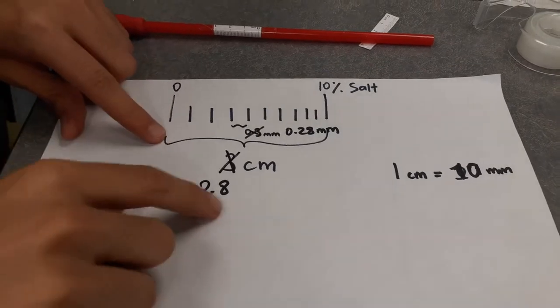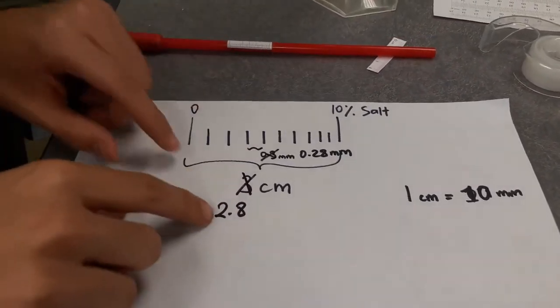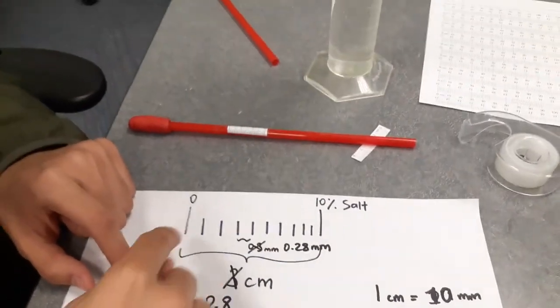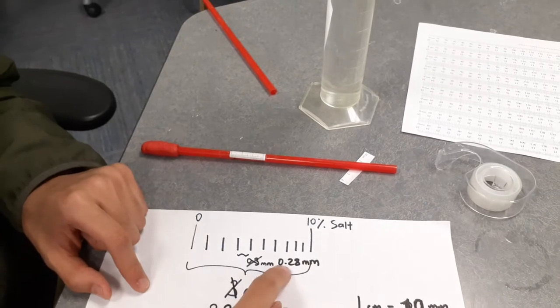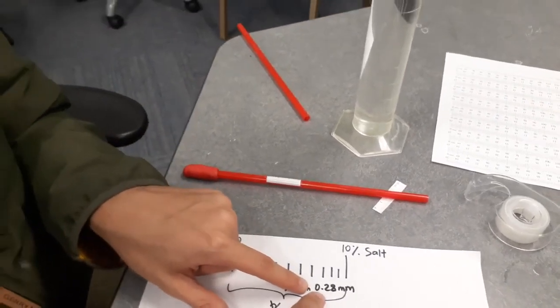Now, from what we can see here, we did some math. We found out the total difference, in this case it was 3 centimeters, or around... actually, no, it was 2.8. And we divided it by 10. Since the whole thing was 10%, we divided it by 10 and figured out each percentage causes this much of a change in increment.